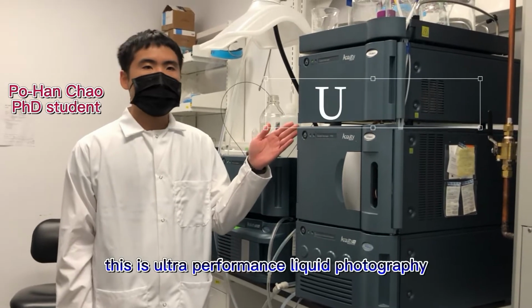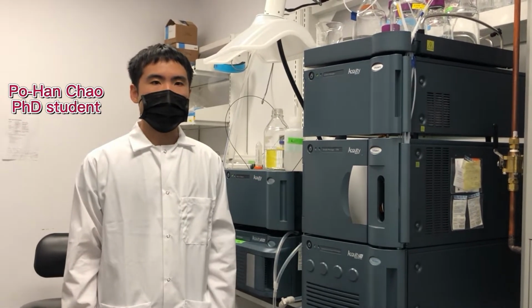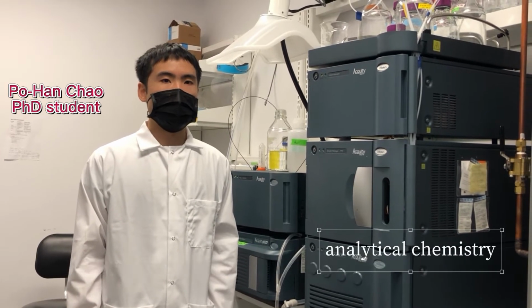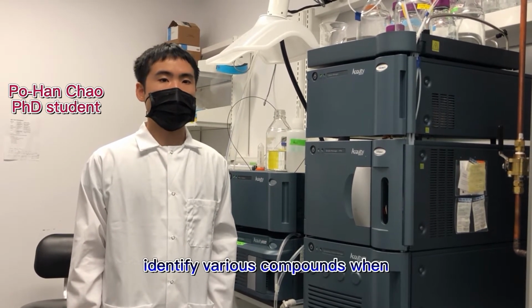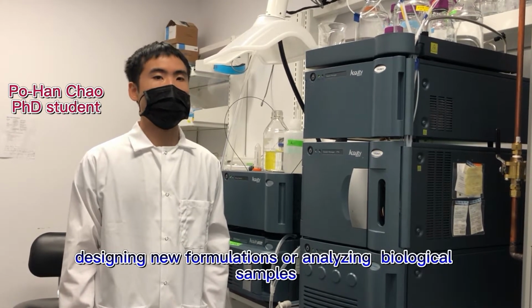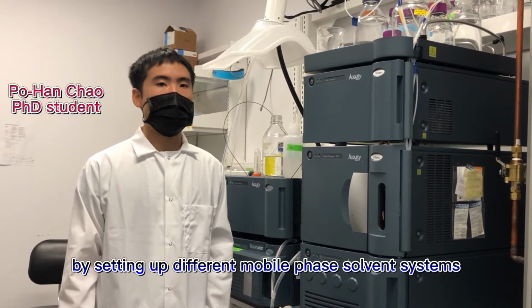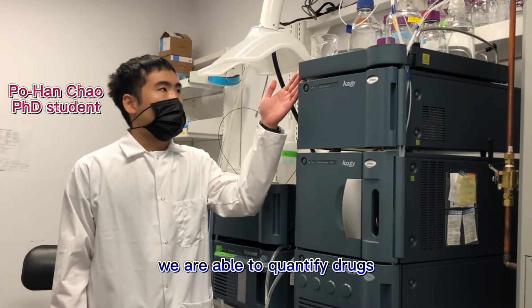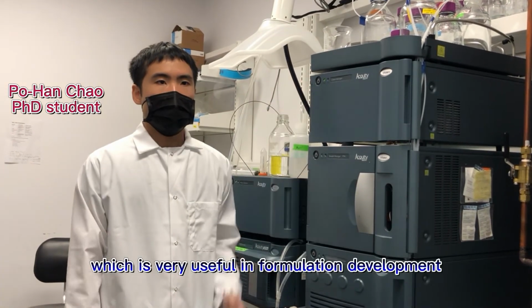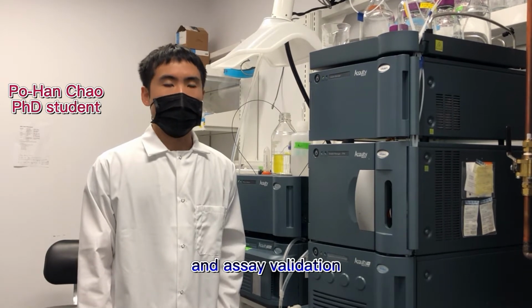This is an ultra-performance liquid chromatography, UPLC for short. UPLC is a powerful analytical instrument that we use to identify various compounds when designing new formulations or analyzing synthesized and biological samples. By setting up different mobile phase solvent systems, we are able to quantify drugs, lipids, or peptides, which is very useful in formulation development and assay validation.